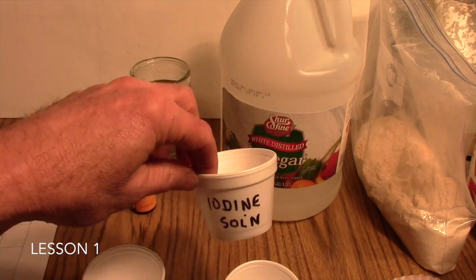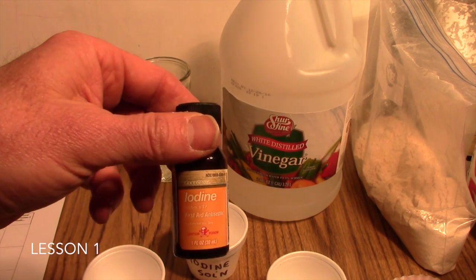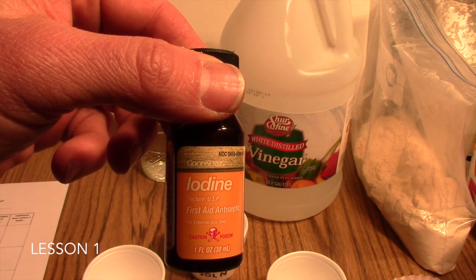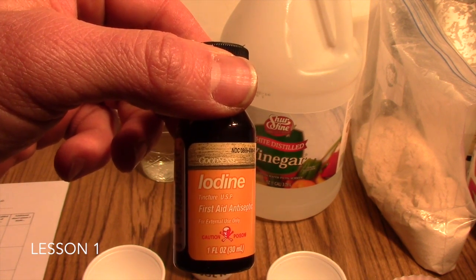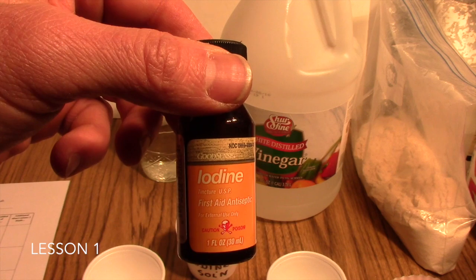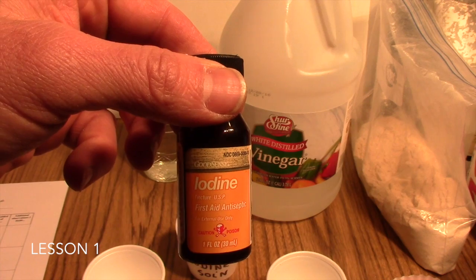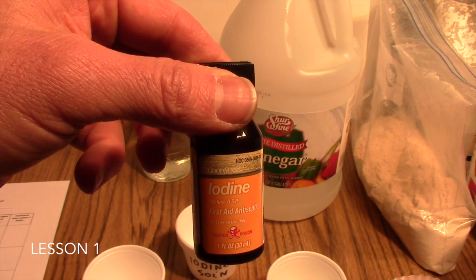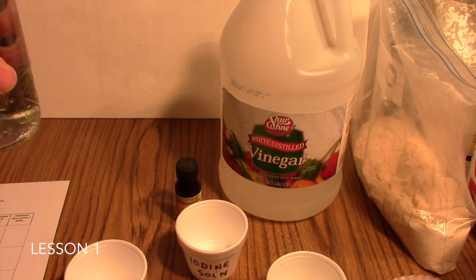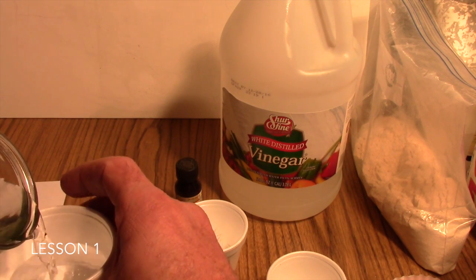And then to prepare the iodine solution, what you can do is go to a local drugstore or a pharmacy, and even some grocery stores carry it, and find tincture of iodine. It's usually in the first aid section of the drugstore. Tincture of iodine now is a concentrated form of iodine, and you'll only need a few drops of this in water. So what we'll do here now is I have some water, and I'm just going to make our testing solution of our water here.